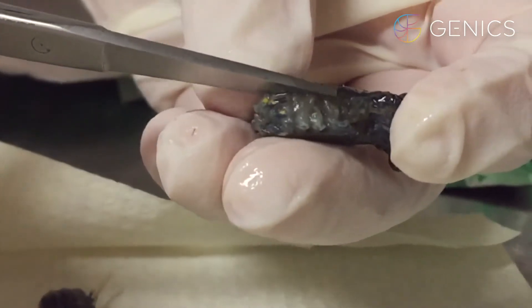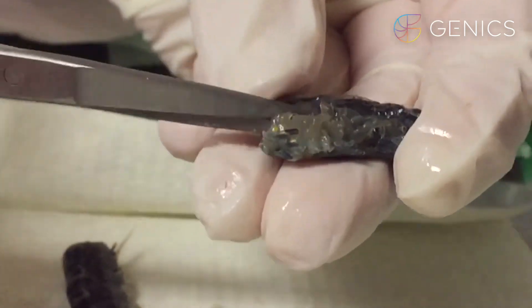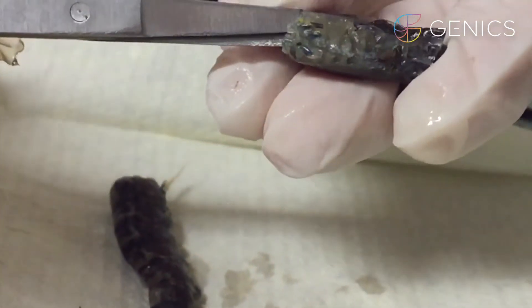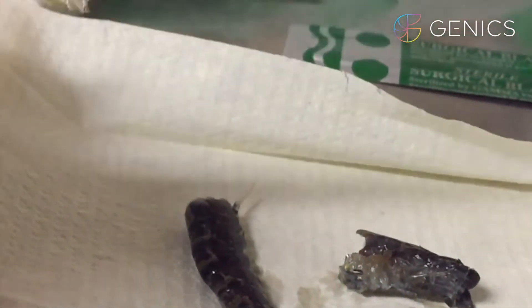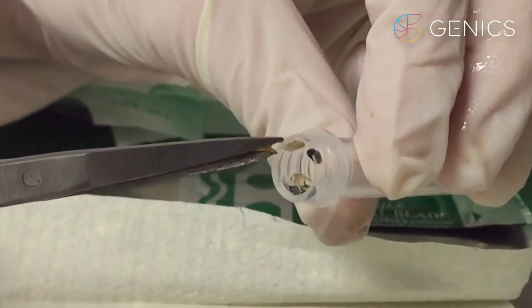Now, I'm going to trim down into the face muscle on this side of the shrimp to be able to access the hepatopancreas. I will snip in here a small piece of hepatopancreas and put that into our tube for shrimp multipath testing.